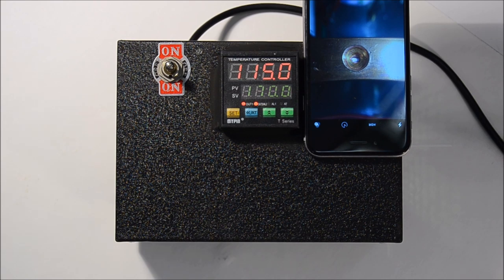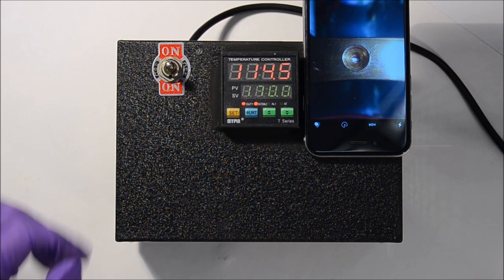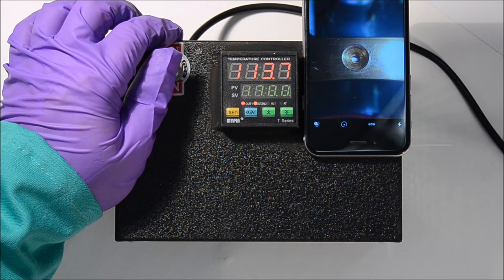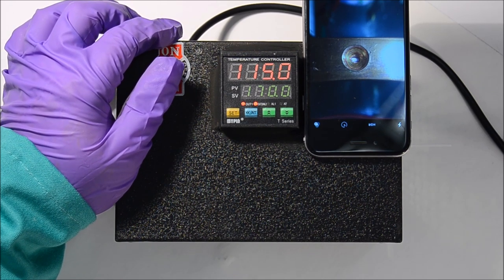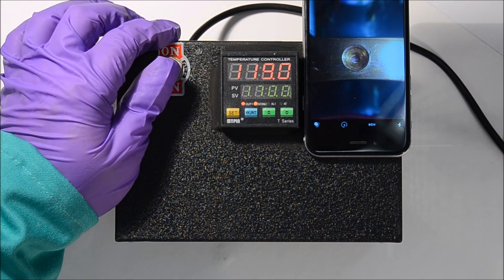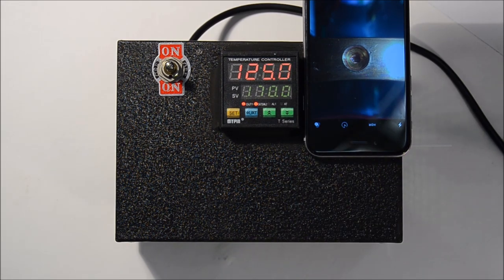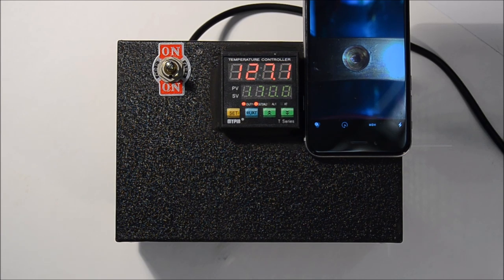As shown earlier, releasing the temperature control at around 85°C still caused the instrument to rise to 115°C. Now that it's at 115°C and close to where we know it will melt, use small bursts by holding up on the switch to heat the instrument incrementally until the sample melts. You'll hold until it starts heating, then release, watching to see if it slows down. Our material has melted in its entirety — you can no longer see the white solid in the viewer. Make sure you record both temperature measurements to report to your TA.